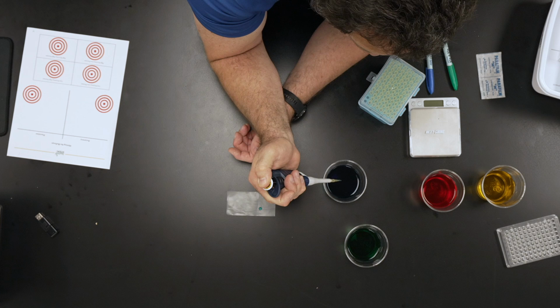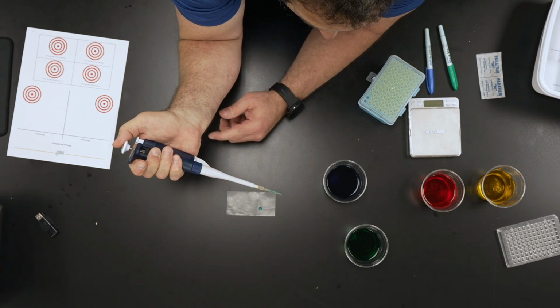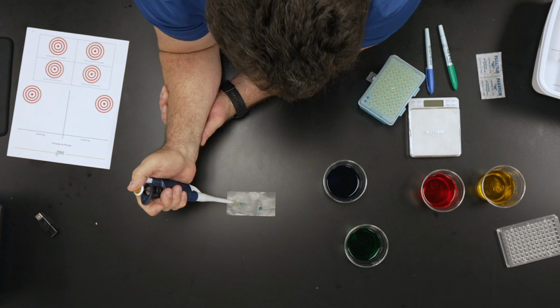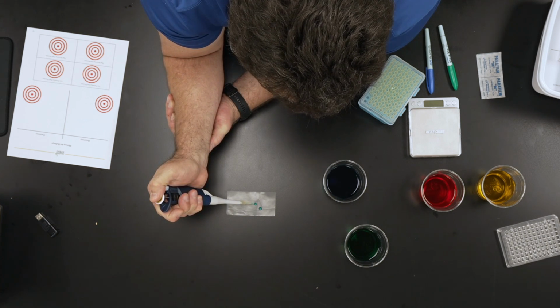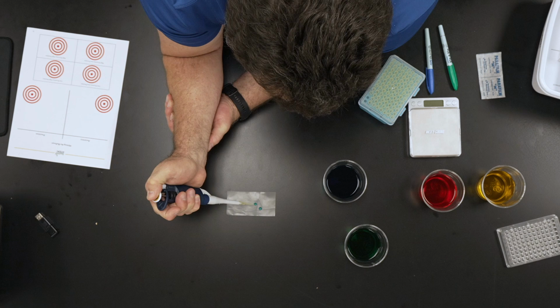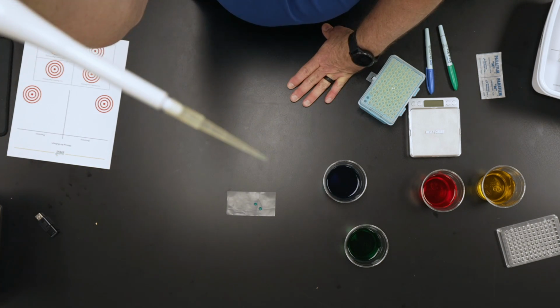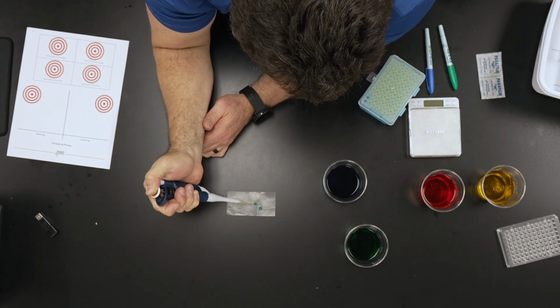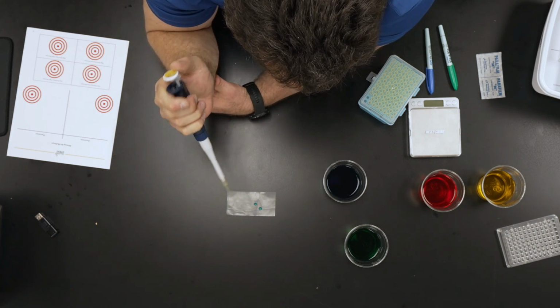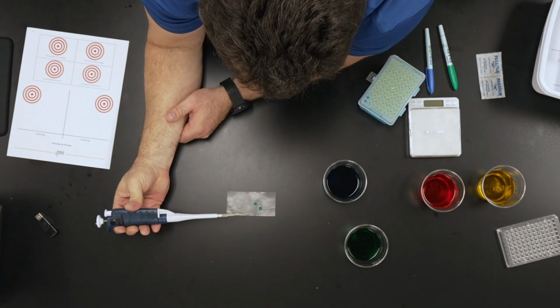So I'm going to slowly pull this up. I get to 60 microliters. There's no air bubble in there, so I'm pretty confident I've got that volume. I'm going to put another bubble down here. Slowly push down to the first soft stop. And I don't know if you can see, there's a little liquid left in that. I need to get that liquid out. So that's where I'm going to push down to the hard stop, okay? I've got these two liquids, and I've got 60 microliters and 60 microliters.